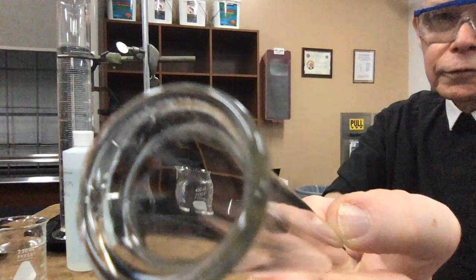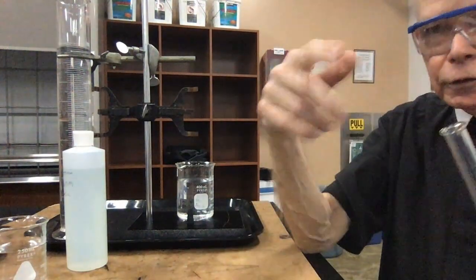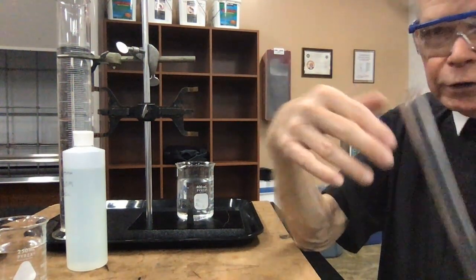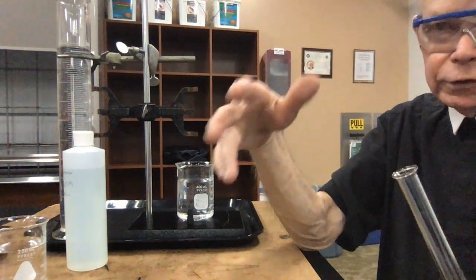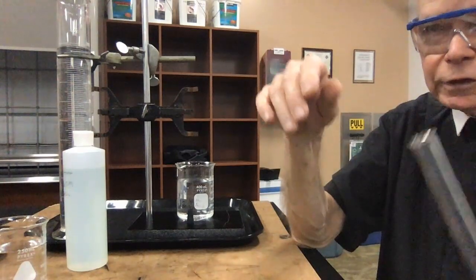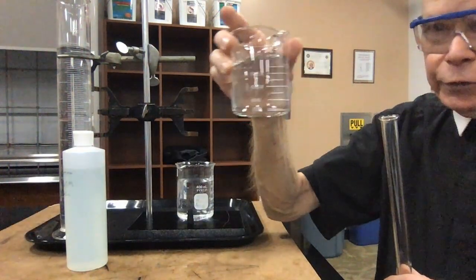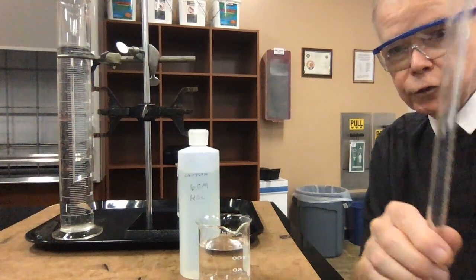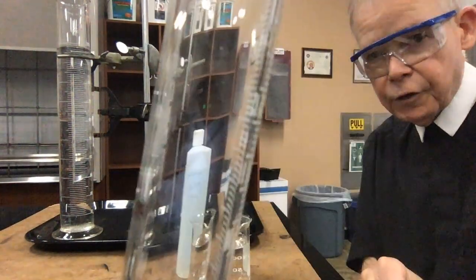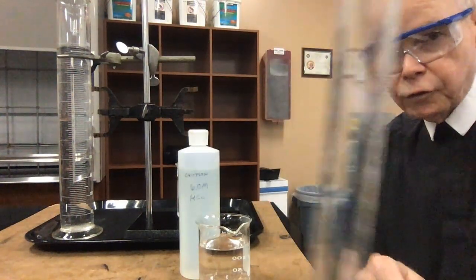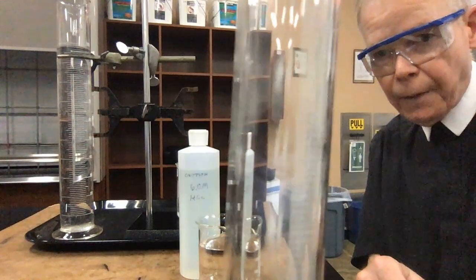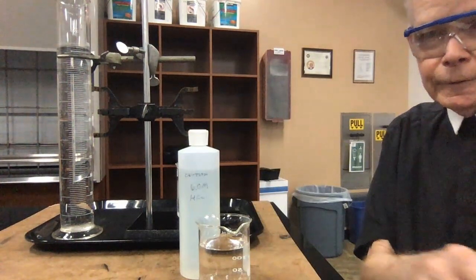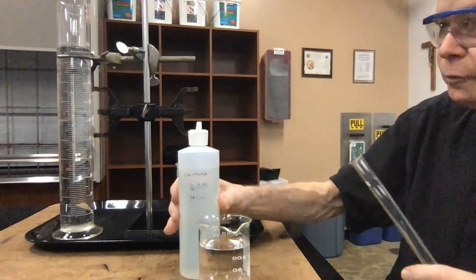That's one of the purposes of doing my reaction here in a tube with an opening on it. If I get a gas, the gas will produce a pressure, but the pressure in turn will be eliminated by or reduced by water in the tube that's leaving. So let me take a beaker and my acid, and I'll start to fill the tube. I'm going to put about 7 milliliters of hydrochloric acid into the tube, and as you look at it, you're reading the numbers upside down because it reads from the top of the tube up here where it's closed, and it reads down. So let's put some acid in. Put about 7 milliliters in.